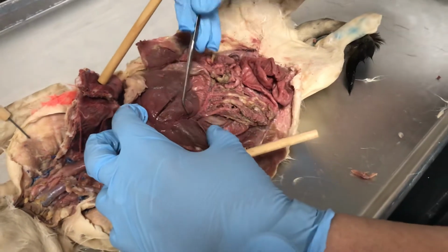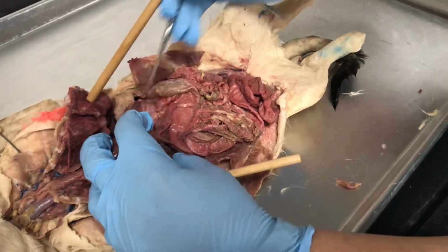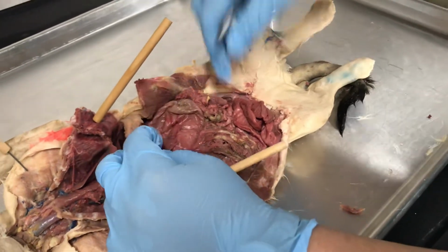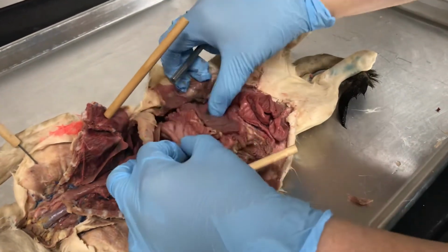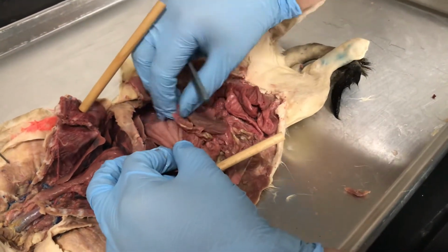In humans we have 4 lobes, but in the cat it's different. You see there are more lobes than we can see. And here you see the big J-shaped stomach. Behind the stomach you see the huge spleen. See the spleen, and somewhere here should be the pancreas.